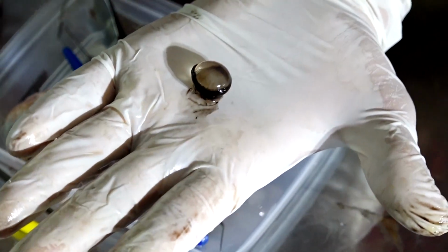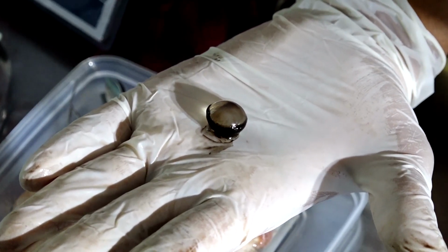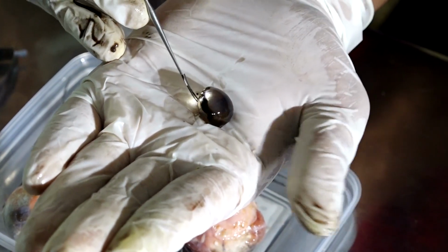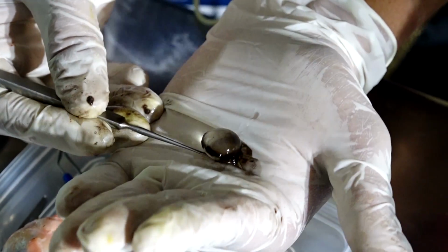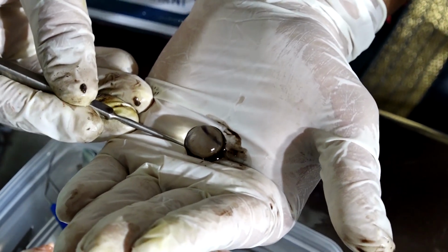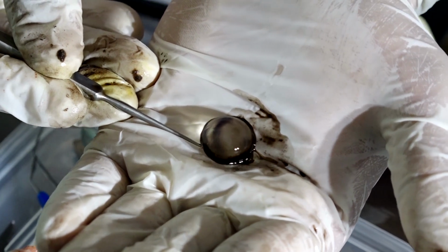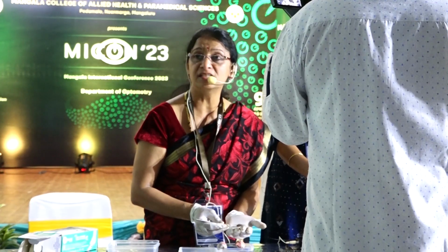Can you see the lens? Is it the first time you are seeing the full lens? Yes. Can you also see that it is like a biconvex structure? It's a very clear lens. Is it cataractous? Do you know what is a cataract? A white opaque lens is called a cataract. Is this a cataractous lens? Is it a brown lens of an aged person? No. It is very clear, indicating that the age of the goat may not be too much. It must be a young goat.